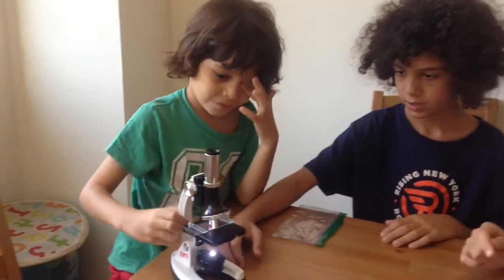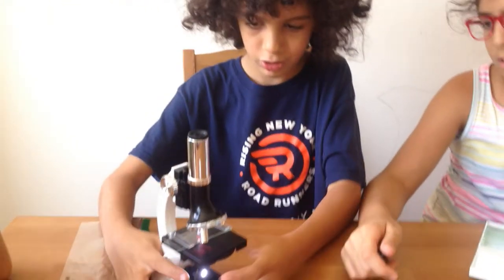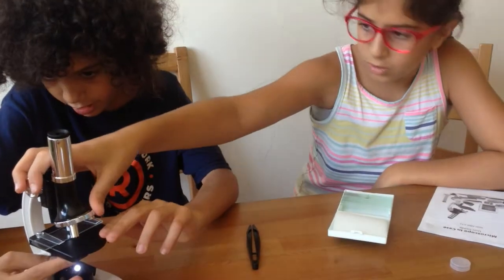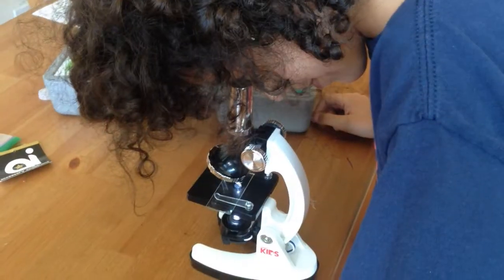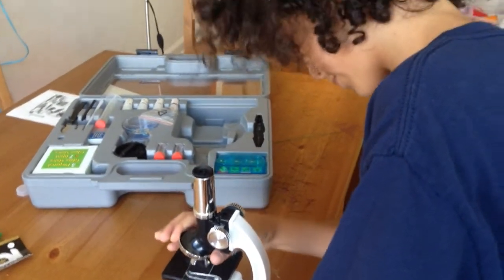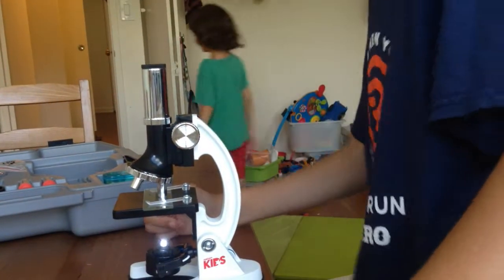Here you could switch the lens. Can you see it? Yeah, it's red. I'm going to try and switch the color to something else. You don't switch color, Joseph. Let's try out something that could be maybe closer. Wow, but now you can't see anything. I want to try a different thing. Whoa, so cool!